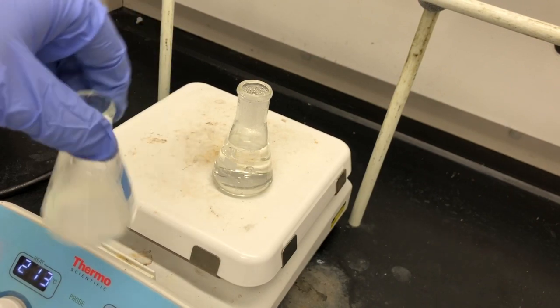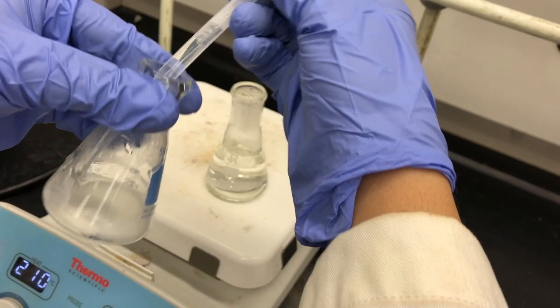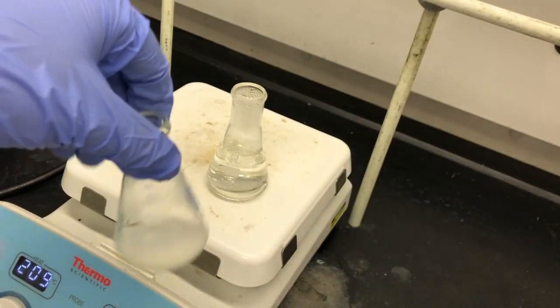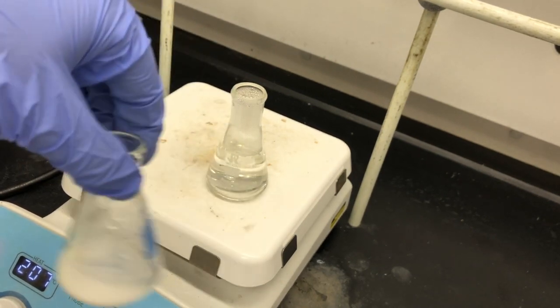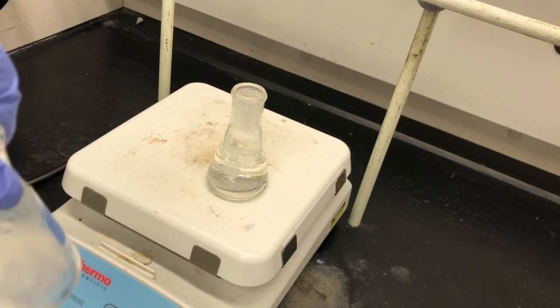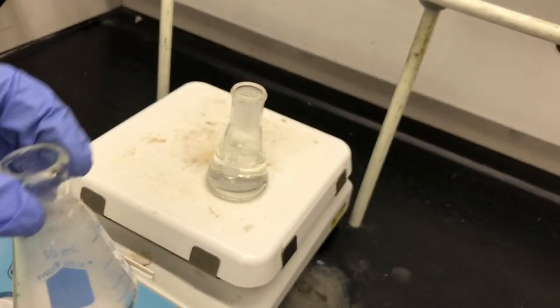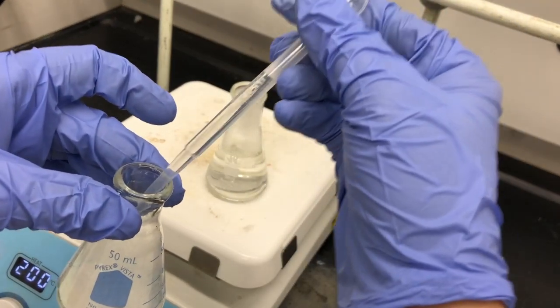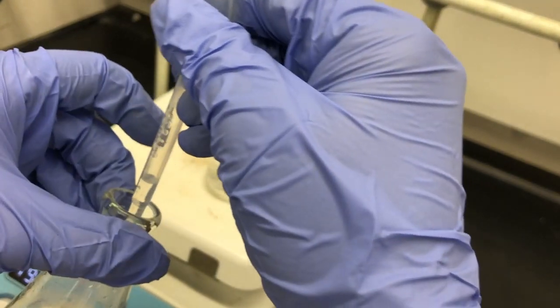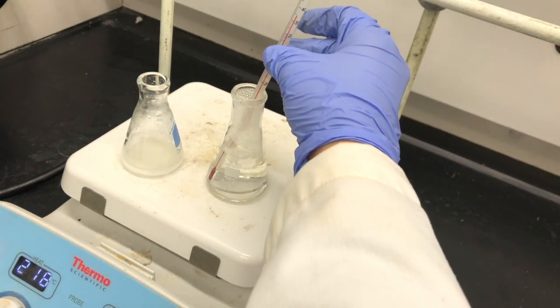The most important part to keep in mind is that you want the minimum amount that allows it all to dissolve. It's not completely dissolved yet. You want to make sure you keep swirling as you add the water and then take a look whether or not it completely dissolves. It looks like it's not completely dissolved yet. So what I'm going to do is I'm going to actually let it warm up a little bit to help it dissolve. I had cooled down the water, so maybe slightly less than 95 at the moment.